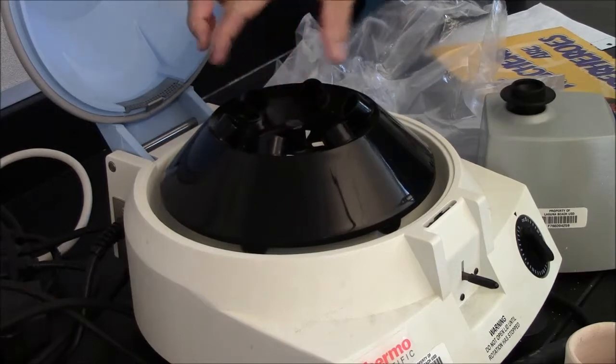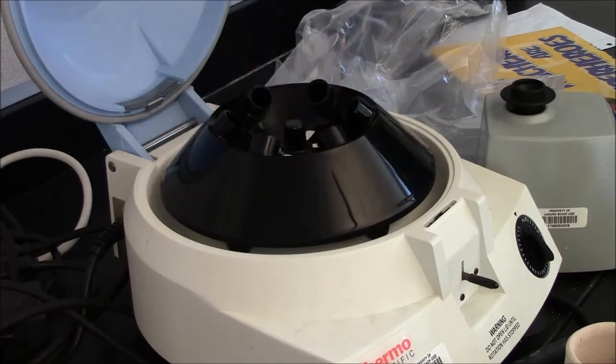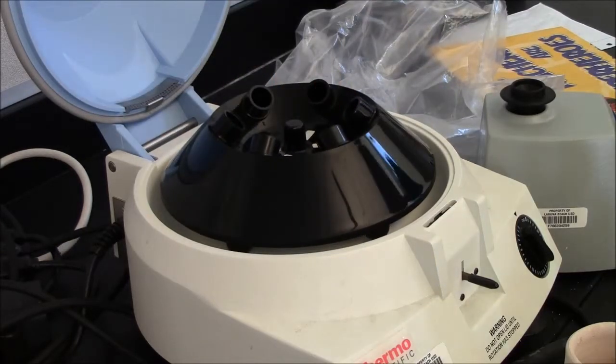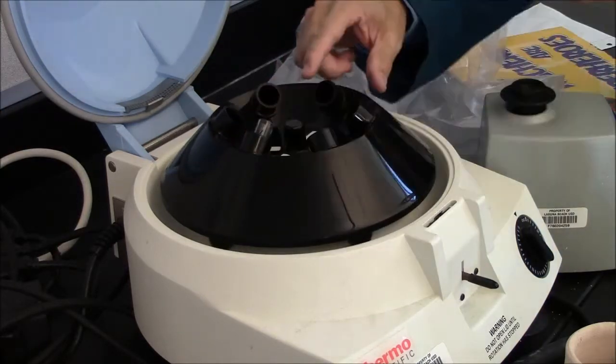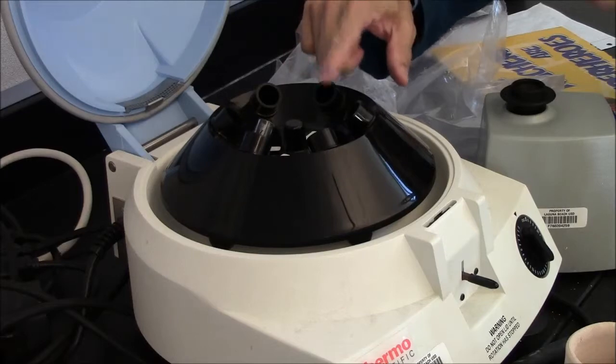It is very important that you have balanced tubes. Meaning, if I put one tube on this side, I need a tube of equal mass on the other side.